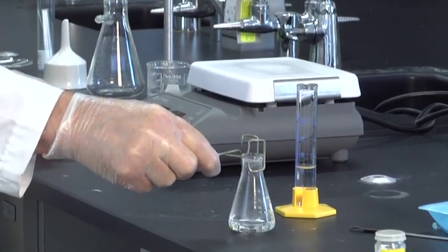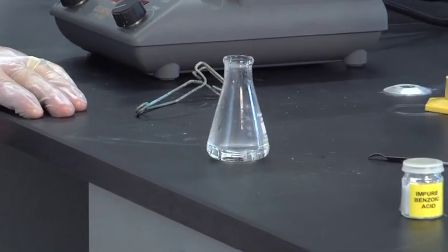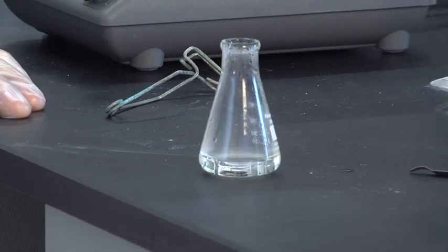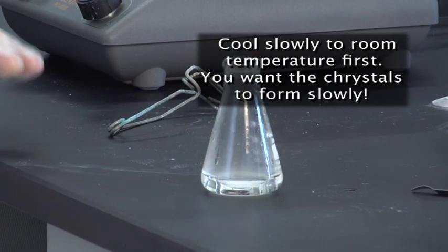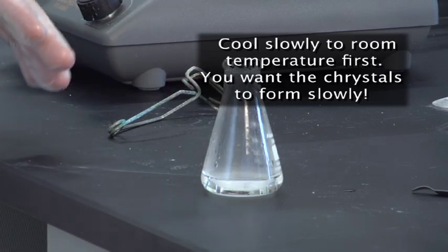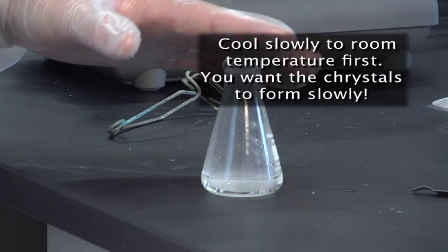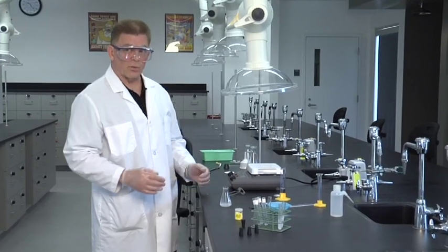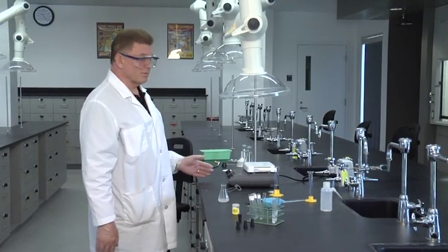Watch closely — I take it off of the heat, and we're going to see this cloud up within a minute. The crystals will start to form. You can see it clouding up now. What we want to do at this point is just leave it sit quietly and let it cool to room temperature. Eventually we're going to put it in ice, but not now — let it get to room temperature, let the crystals form slowly. That's the best procedure. While this is going on, I'm going to get ready for the next part of the procedure, which is going to be the vacuum filtration.